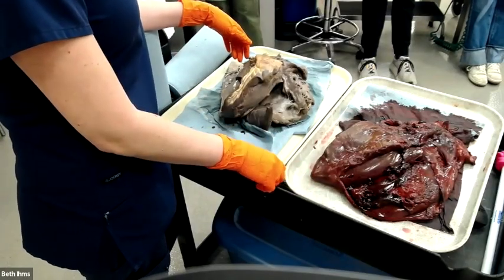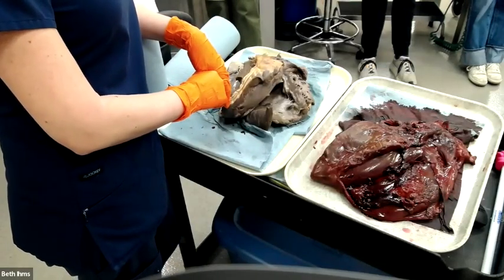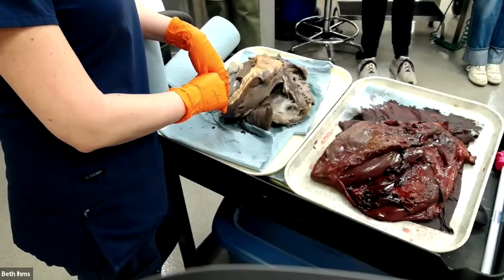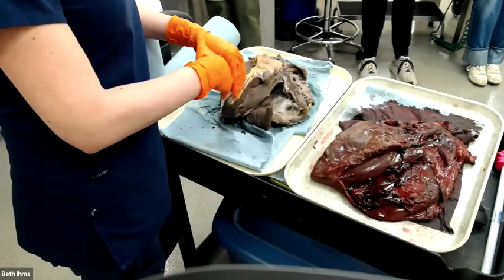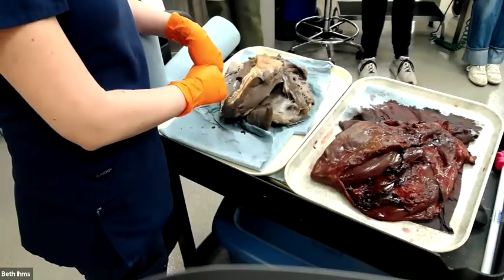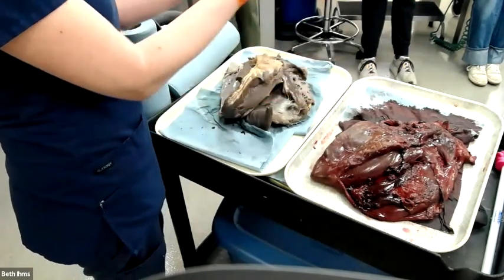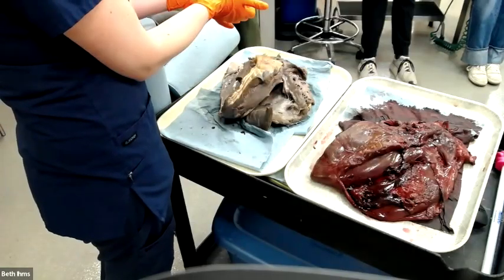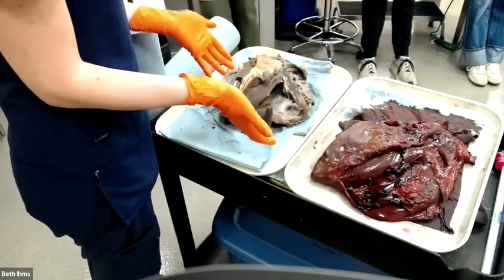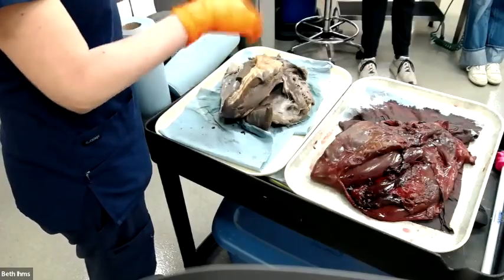I had a question about the verbiage of postmortem. Yeah. So over in that corner, there's the liver mass and then the spleen. And on your little prompts, it said something about postmortem. Yep. Because they have been removed from their blood supply. There's no such thing as postmortem. That tissue came out of a live animal and went right into formalin. Okay. There are no postmortem changes. There may be examples of autolysis if someone took that out, put it in the fridge and forgot it for 2 days. It would start to rot, but it's not technically postmortem because the animal's live. Got me on a technicality there. I wrote those last night. I was like, it's 5 o'clock. I want to go home. Postmortem.